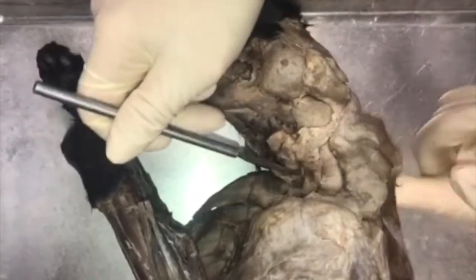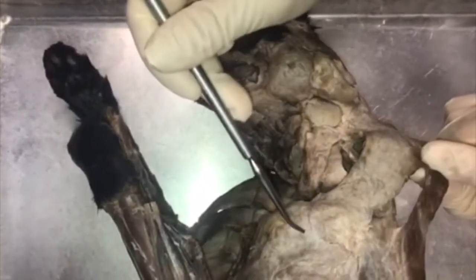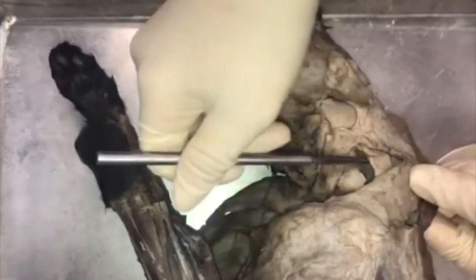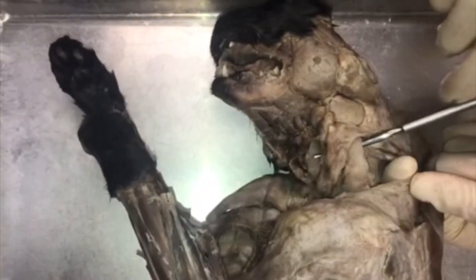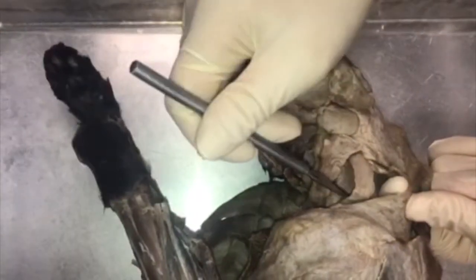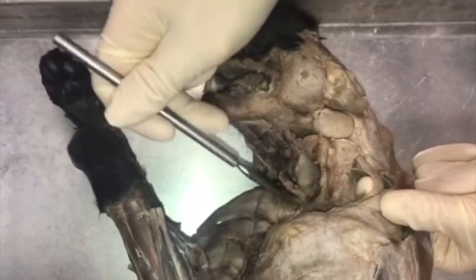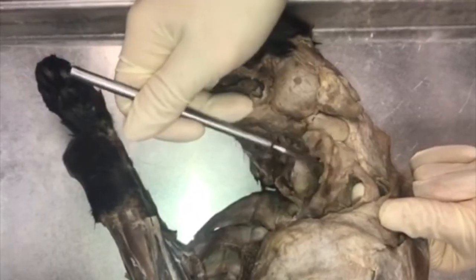Moving down to the muscles between the shoulder and the head, you want to take this muscle, which is going to be your clavodeltoid and your clavotrapezius, out of the way, as well as your levator scapulae ventralis muscle — pull that out of the way too, so you can clearly see these two muscles here. This back one, coming from your clavicle region to your head, is going to be your cleidomastoid. And this muscle here, going from your sternum to your head, is your sternomastoid.